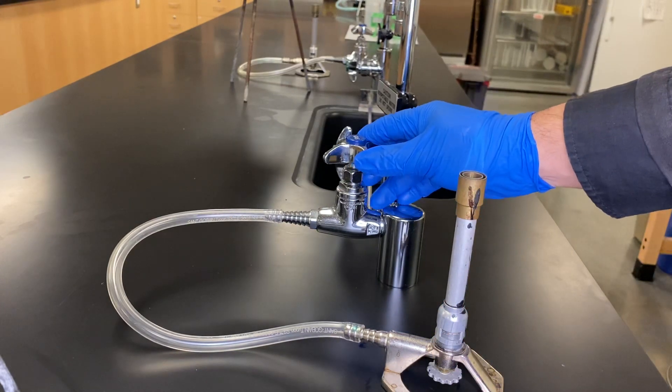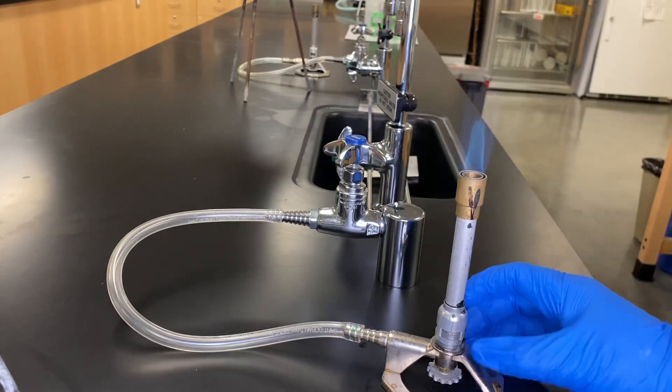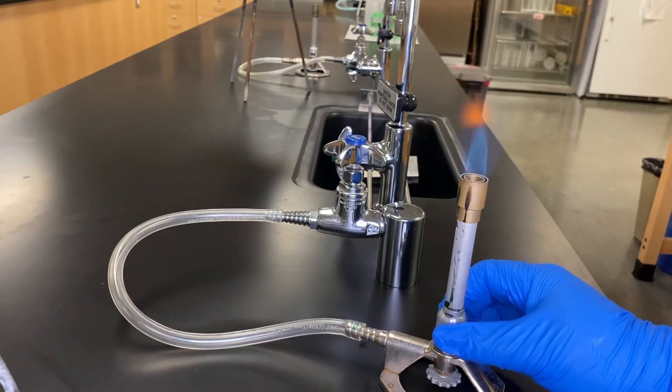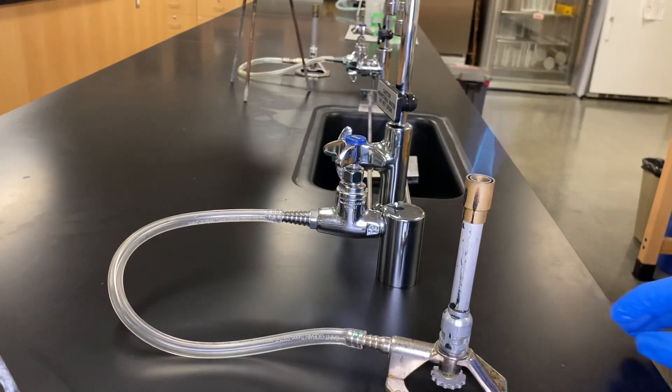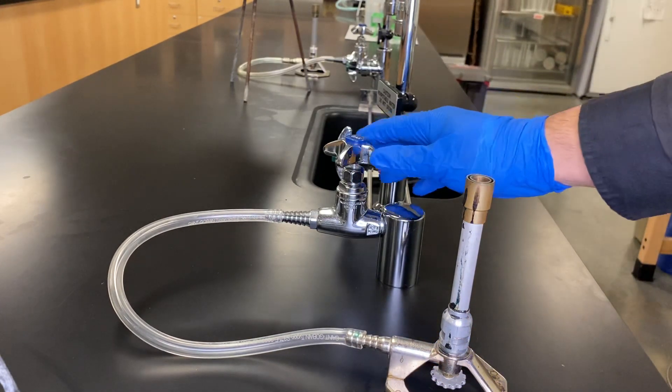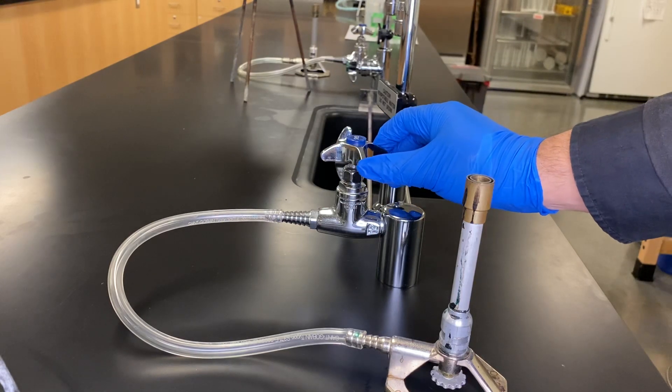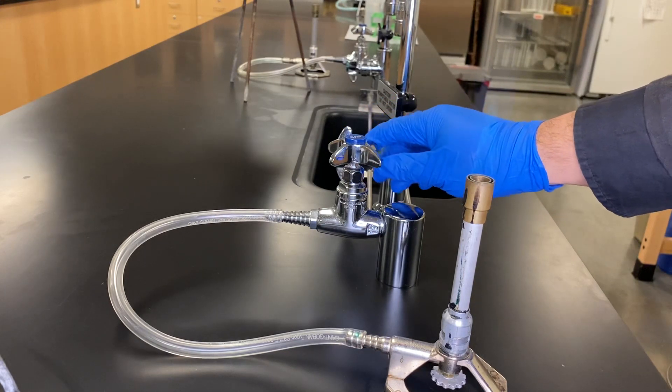And then you'll notice that if you open more gas, let's adjust this guy a little bit more. More flame will go through. So this guy will normally adjust it. And as we close it, it will also disappear or open up.